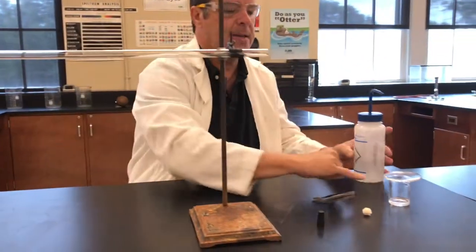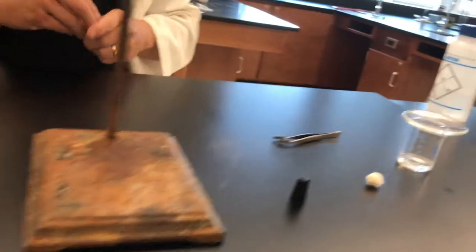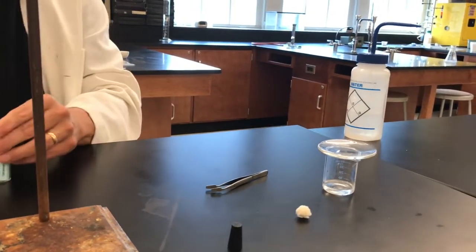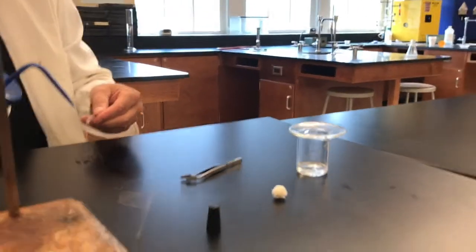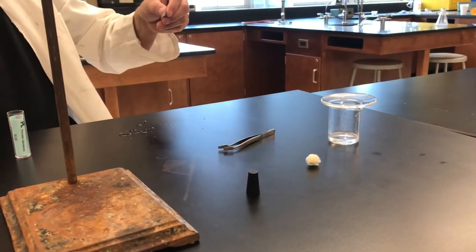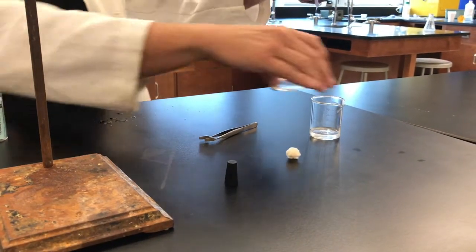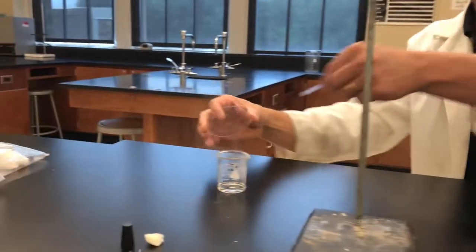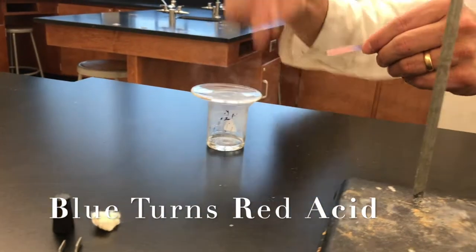So first, in this beaker I have some — I always forget, I'm a little embarrassed to say — I either have ammonium hydroxide or hydrochloric acid. So to determine what it is, let's use blue litmus paper. If blue litmus paper turns red, it's an acid. It got a little bluer, so that must be the base. So let's go over here and see if this is the acid — it's turning red. So we know this is the acid.